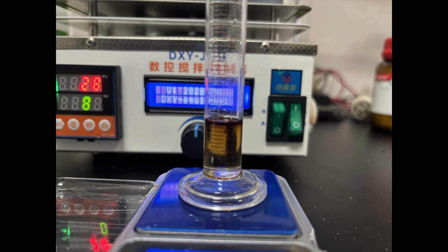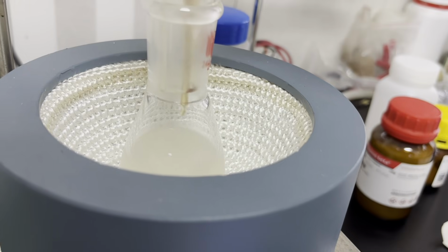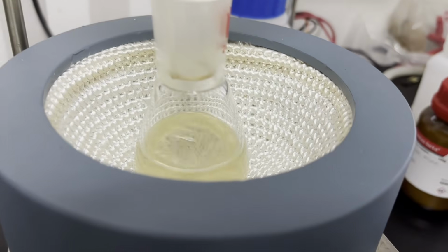I then measured out 2.5 milliliters of around 95% sulfuric acid made by boiling down 37% battery acid. The yellow-brown color was due to contamination by plastic, but it shouldn't interfere. I added the acid dropwise to the mixture, and no apparent exotherm occurs. The solution turned to a clear yellow after all acid is added.